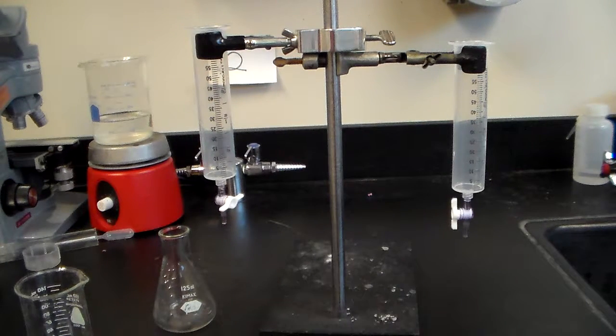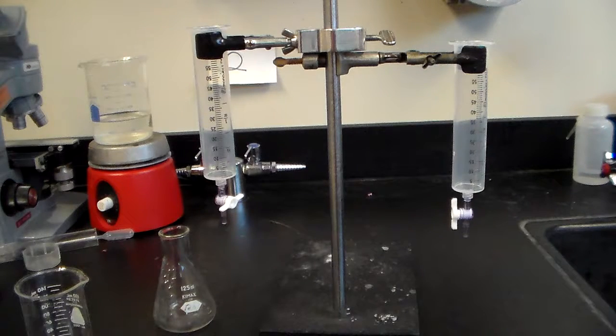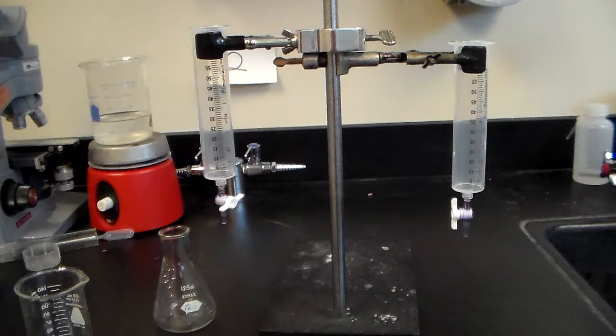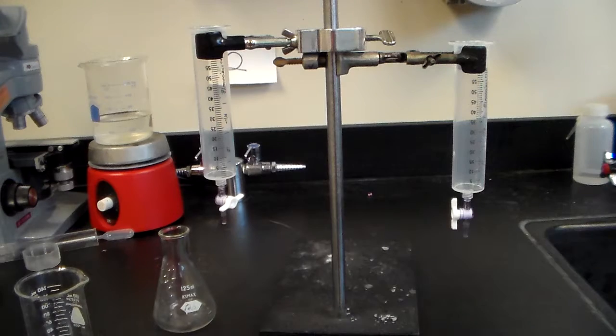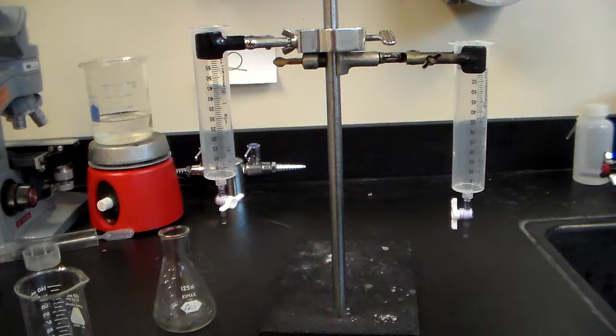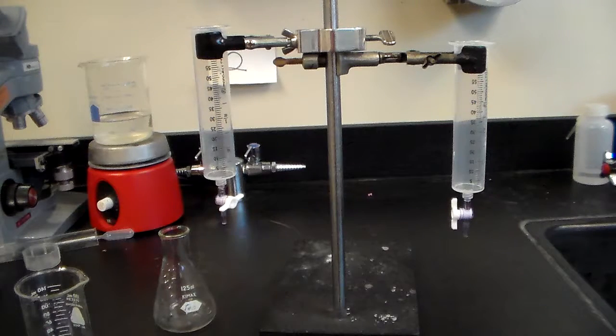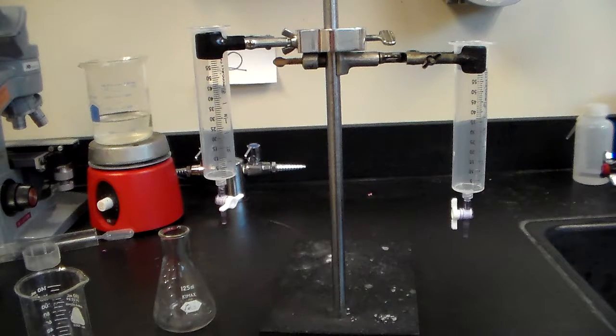Hi, I'm Ryan Liang. Being the 2016 AP Chemistry Student of the Year award winner entitles me to make this video, because let's face it, I'm as cool as Tai Lopez. We're doing the titration lab here.